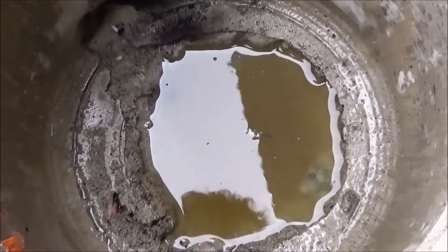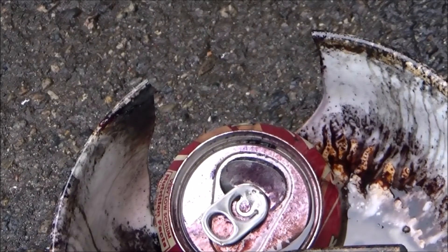I figured out what happened. I went back and watched the video of the acid bubbling out of the jar, and it appears that a bubble formed but it was under some acid and got trapped in the bottleneck. It spilled out, and the cooler acid hit the hotter bowl, and the bowl shattered — surprisingly, but not really — spilling the hot acid into the cool forge. Then all the oil turned into steam and gushed out of all the openings in the forge.